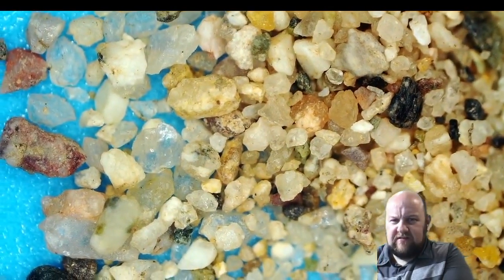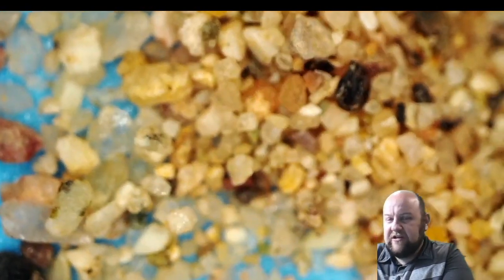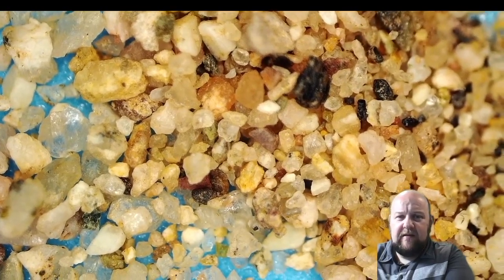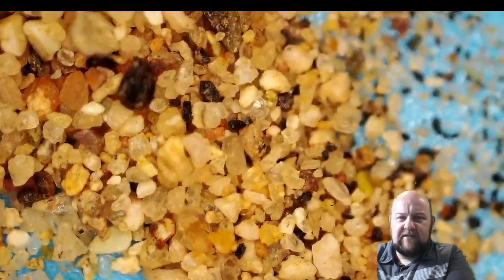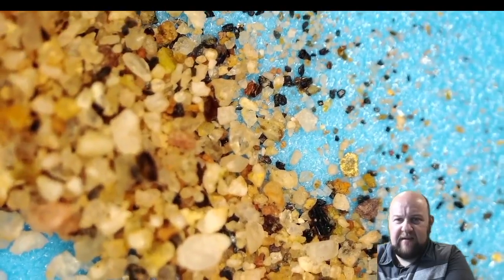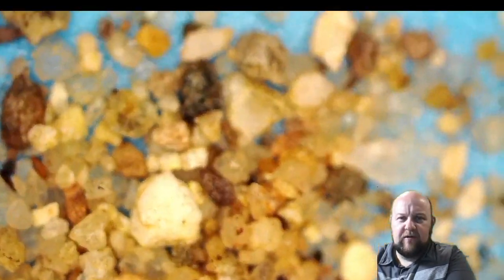Okay, here is the playground sand. Much bigger grains. Looks like big rocks almost from this view, but it is a fairly fine playground sand. It's not the cheap really thick sand. This is good quality playground sand, but compared to beach sand, it's much bigger grains. But similar coloring, peppering. You actually see some of that finer stuff over here on the edges. So it's almost like it has some, but it's just a mix of the fine and the not so fine. Some of these are really big.